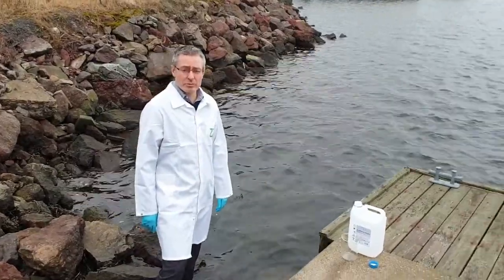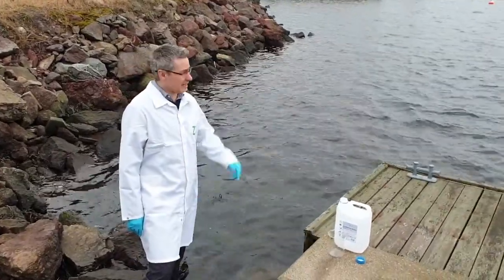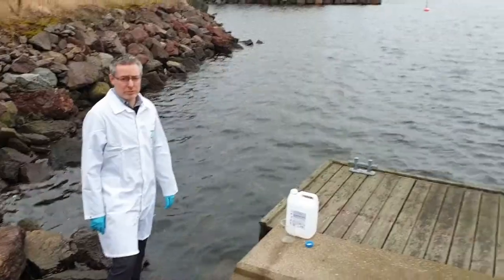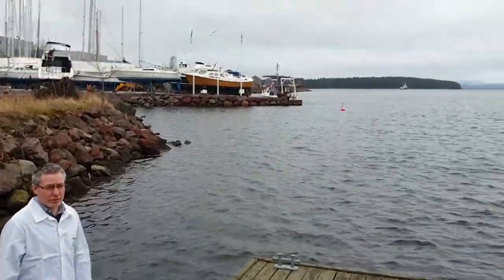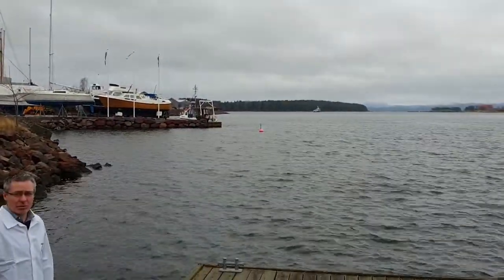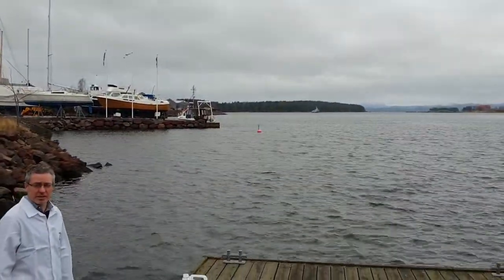So this morning what we're going to be doing is we're actually going to be collecting some water from the Oslo Fjord. You can see that we're down by the water's edge today.